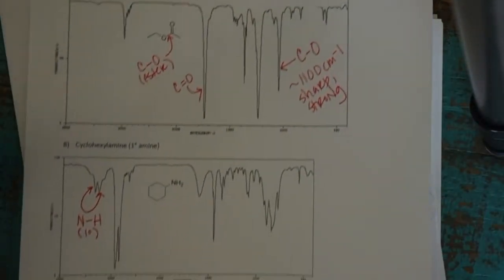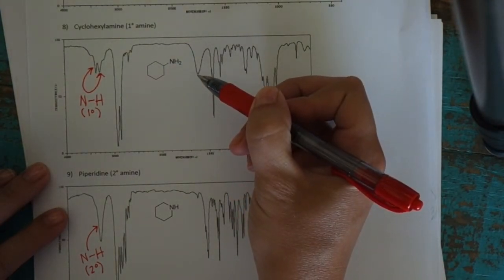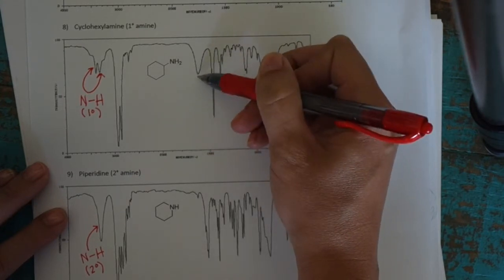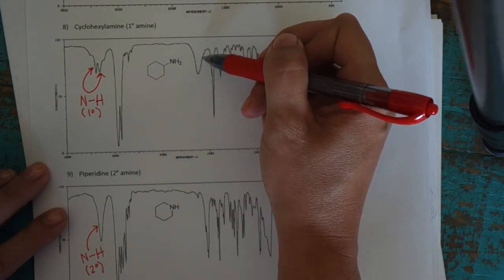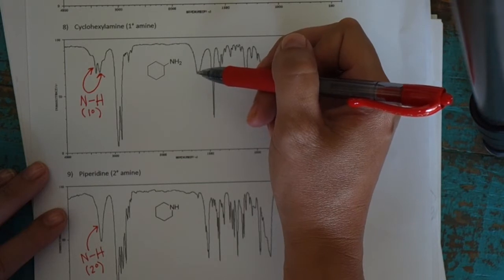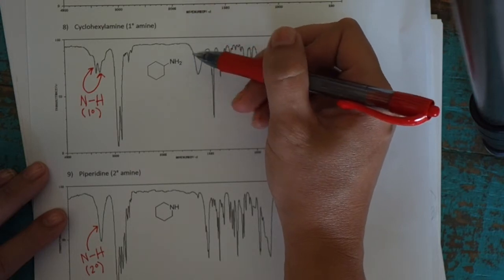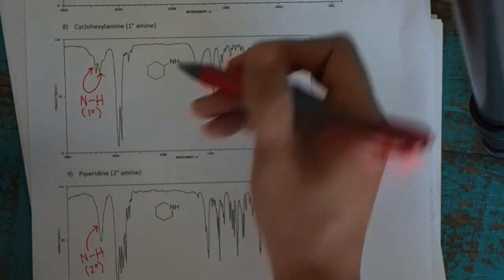Another one that you'll sometimes get confused by is that when you have primary amines especially, you'll get this blobby peak here. And this is outside of the fingerprint region. It's roughly between 1600 and 1700. And this has to do with different motions from the NH bond other than the normal stretching motions. And this will show up, but you'll notice it's not sharp. So it's not due to a double bond. This is not like a carbonyl or an alkene double bond. This is just part of the NH2 group. And you don't need to worry about this either. You don't need to label it, but you will see it, and don't let that throw you off either. That's another thing that can come up.